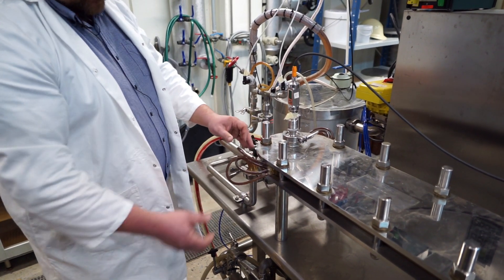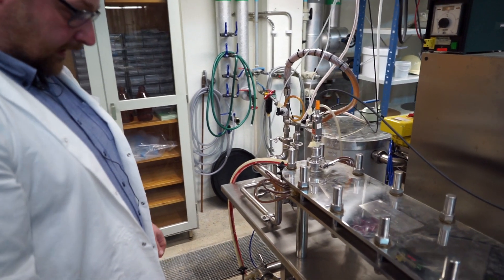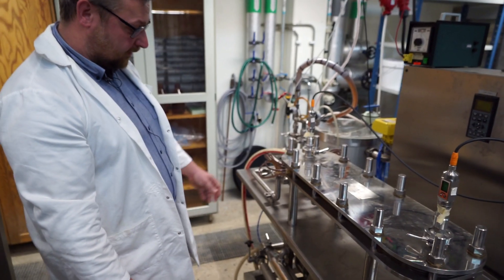And the solutions that have permeated the membrane come out in these tubes here. So we differentiate between feed, permeate, and retentate. That's basically it.